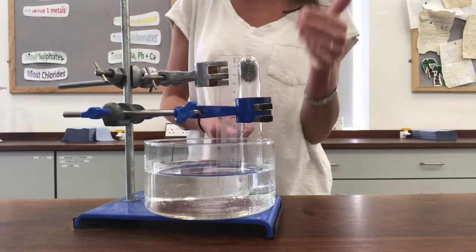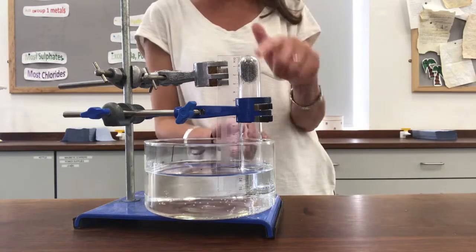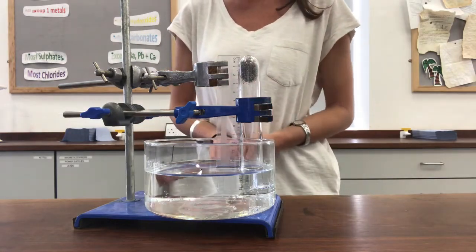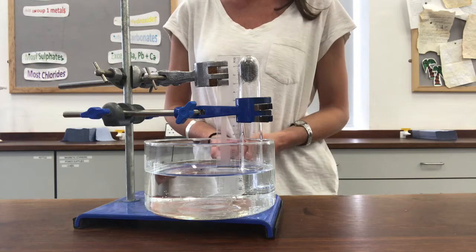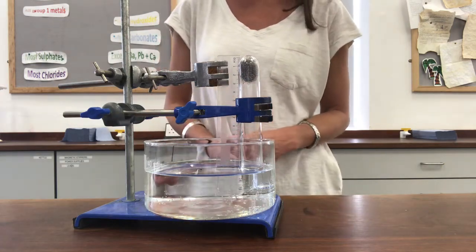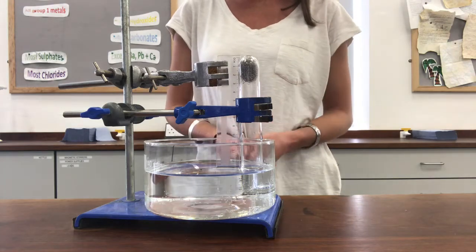We'll compare the length of the air bubble then with the length that it is now and show that hopefully it has reduced by about 20%. So I'll set that up, leave it on the windowsill, and I'll see you again in a week.